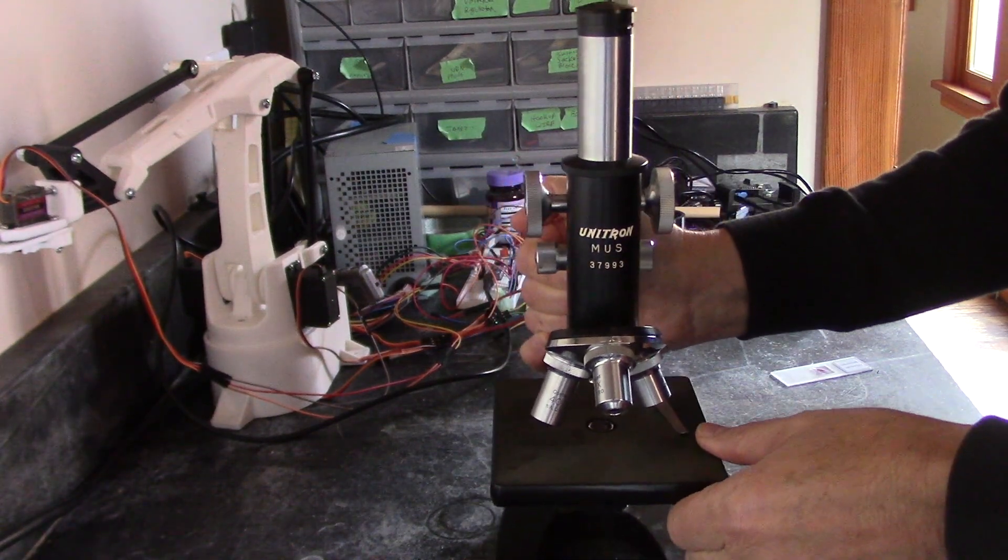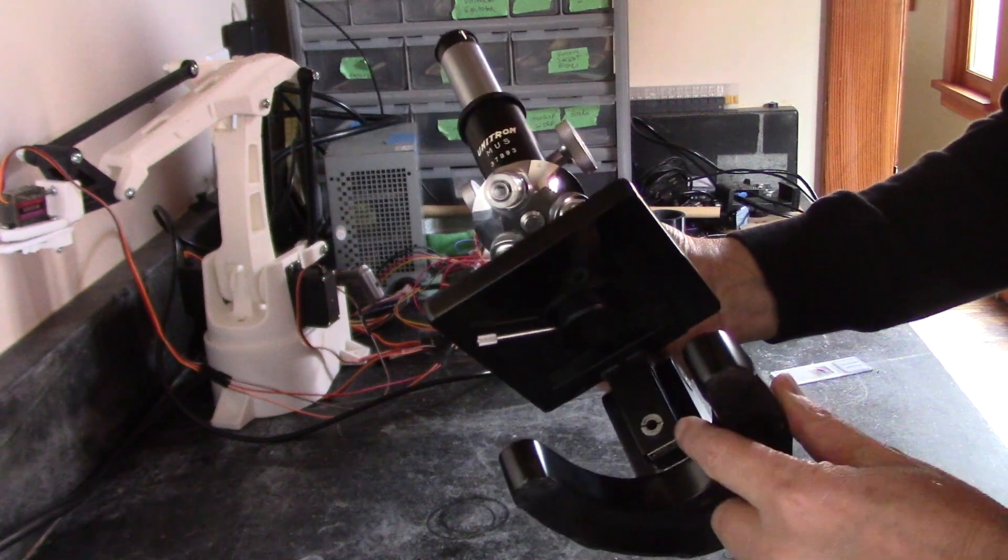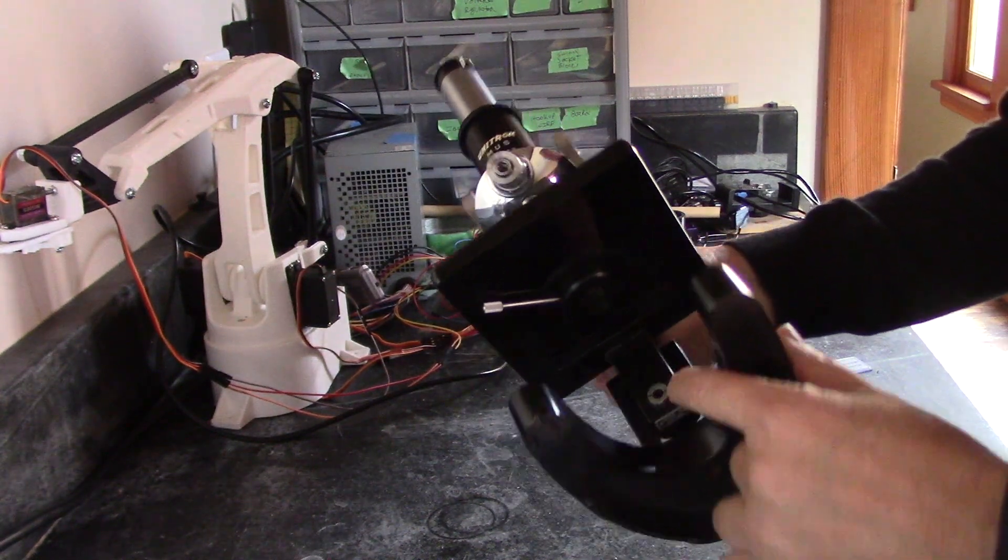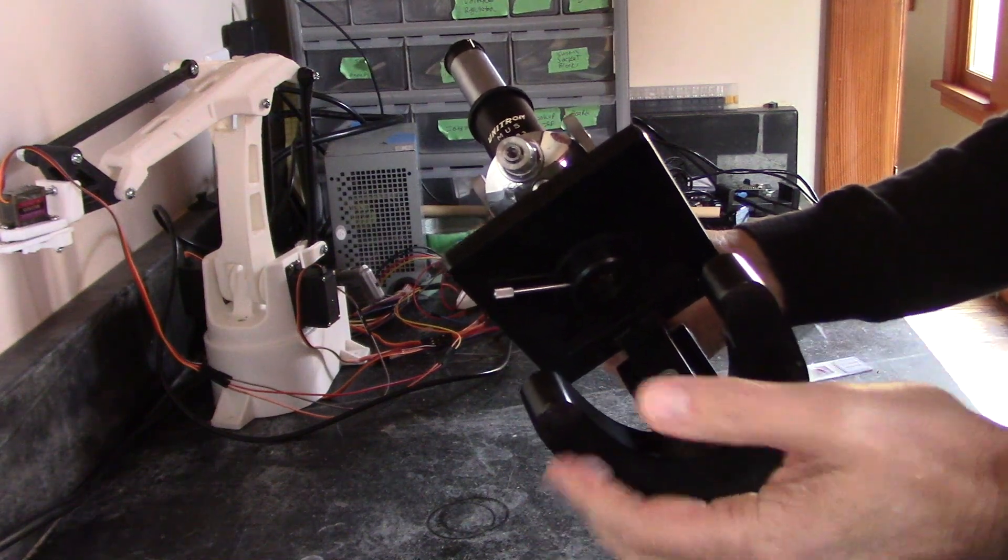So that's not too big a deal. And then the next problem is that I don't have a light. So I've managed to get a light to work and it works just fine.